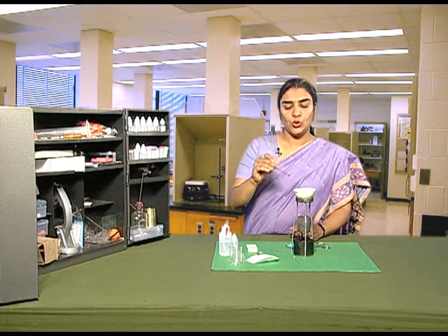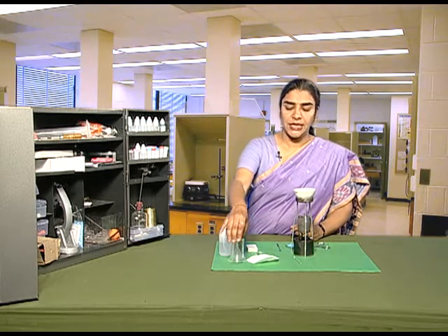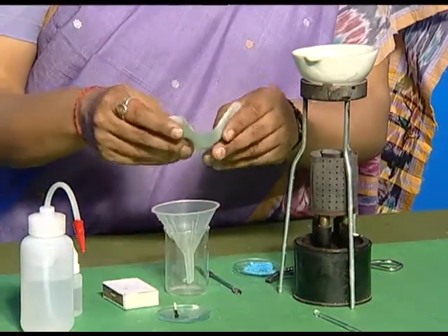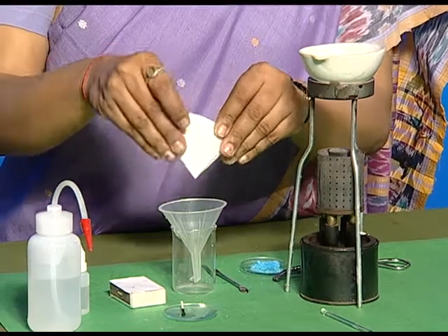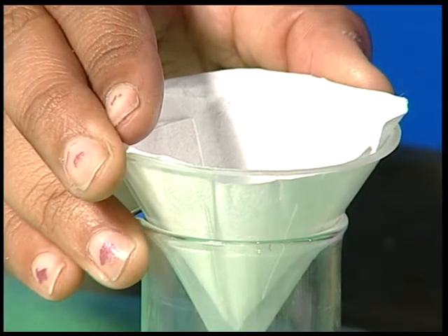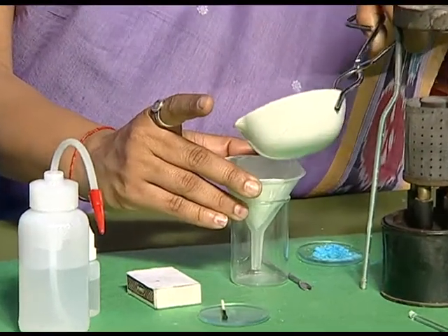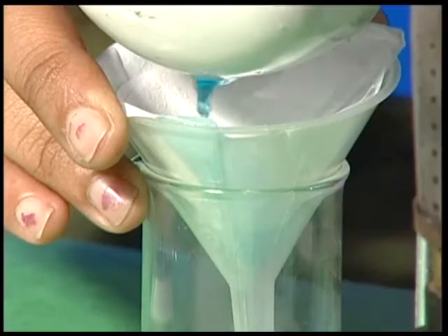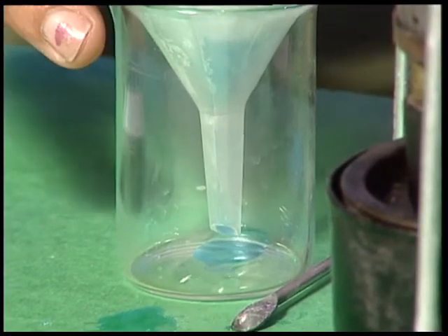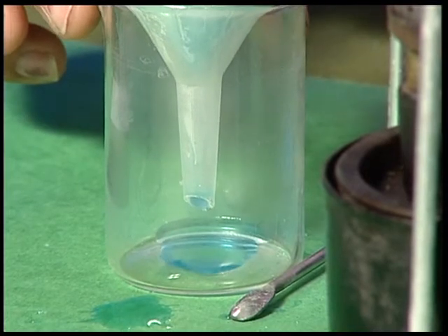Now take a beaker, fix a funnel onto it, and arrange the filter paper in a cone shape onto the funnel. Now take off the solution from the burner and filter it. Let the solution get filtered slowly.